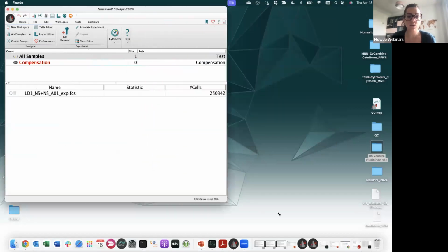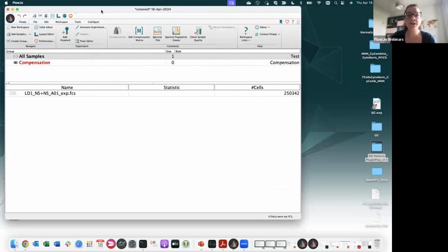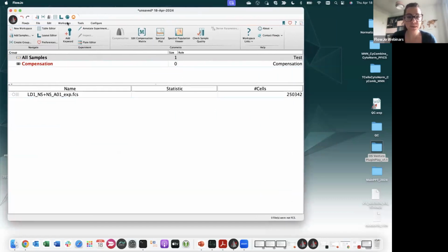And to the initial question, where is the check sample quality? It's right here under FlowJo, under the cytometry band, okay? Now, to inspect the file, you can just double click on the circle.